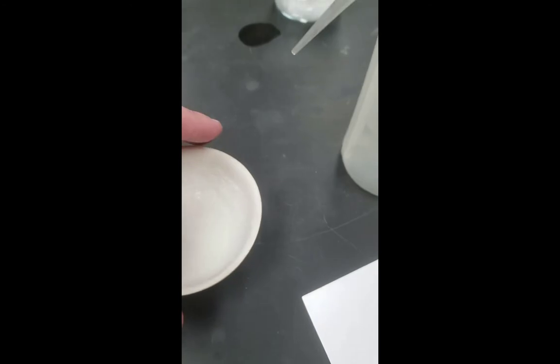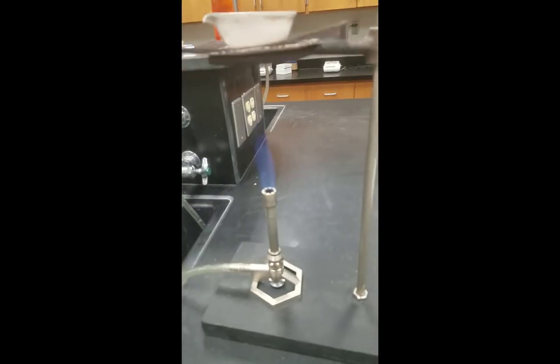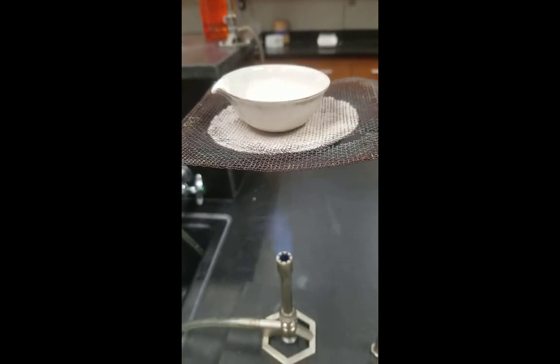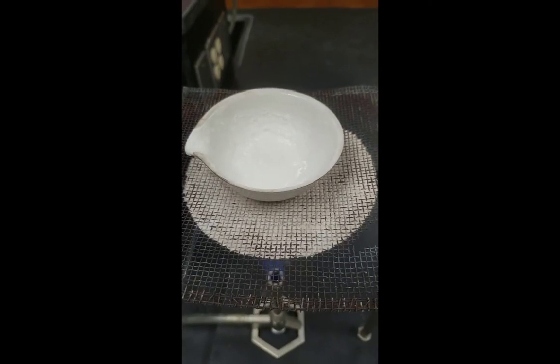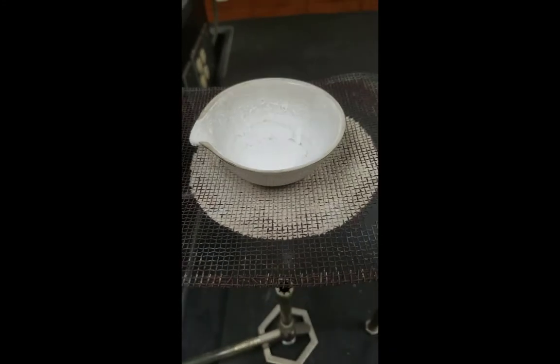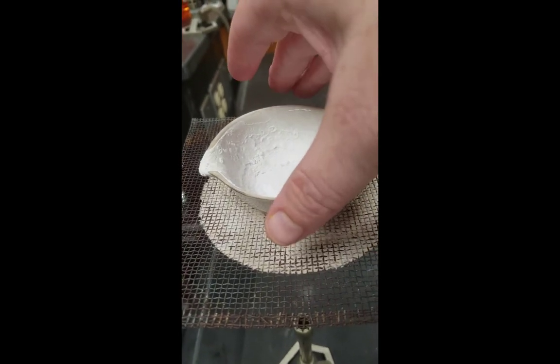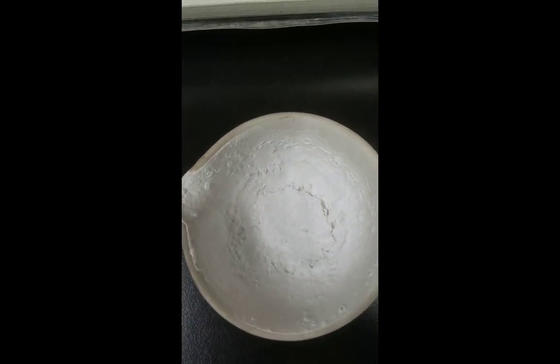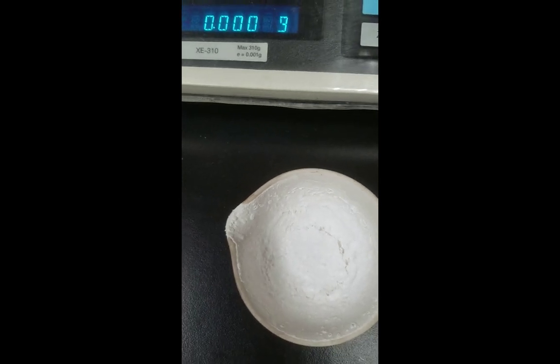The evaporating dish has been removed from the steam bath and now it's going to be heated directly by the Bunsen burner at some distance — we want some distance because otherwise the solution might boil too vigorously and spatter. All water should have been removed by this more aggressive heating. The Bunsen burner has been turned off, and after allowing it to cool for just a few minutes, I remove the evaporating dish from the wire gauze. Finally, to complete the experiment, I weigh the now dry salt which is in the evaporating dish.